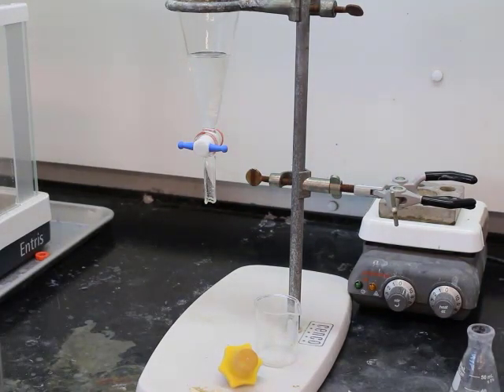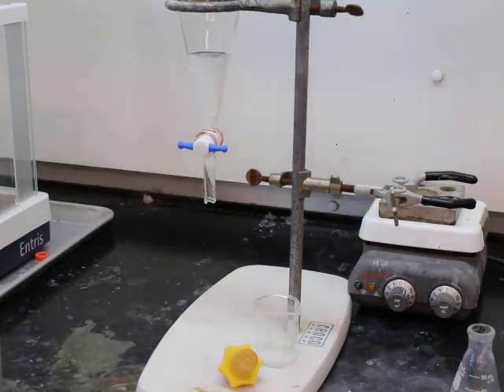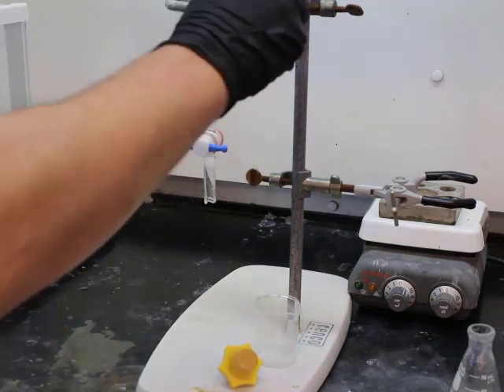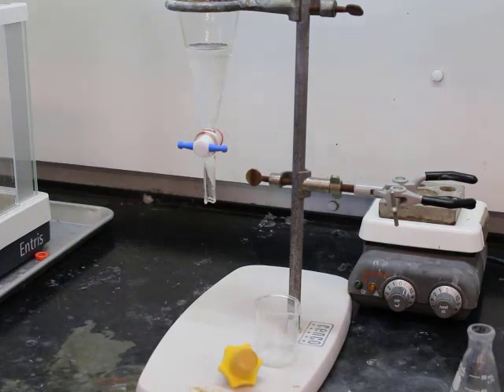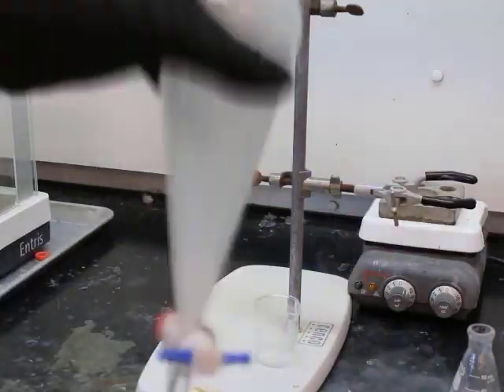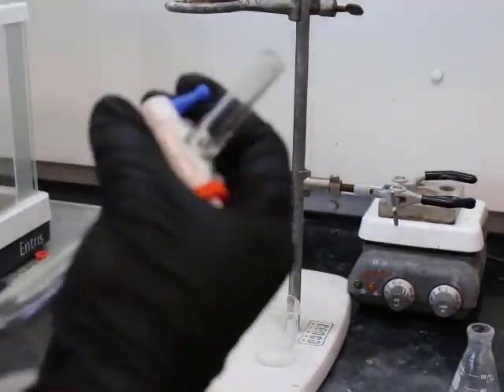Now to the organic layer. Per the instructions, we are going to now add 5% HCl. This will react with any base that may be present in our organic layer, and if it does react, it'll turn that base into an ionic compound, making it much more soluble in that aqueous layer, in the HCl layer, which is aqueous.